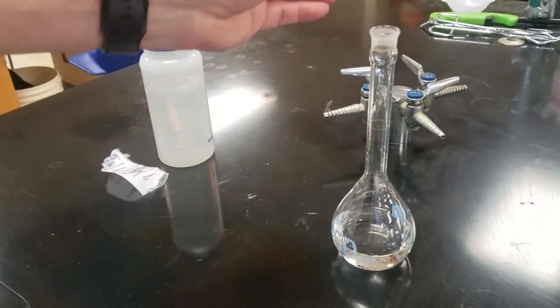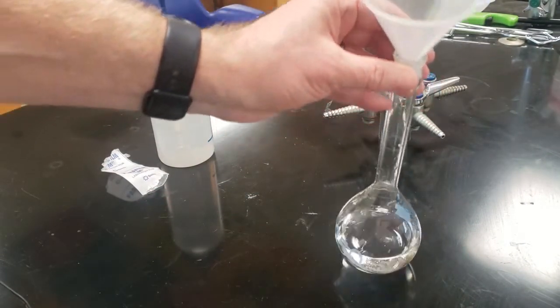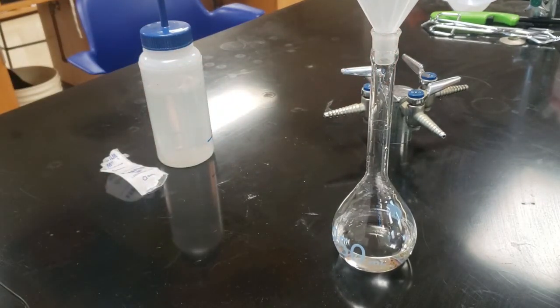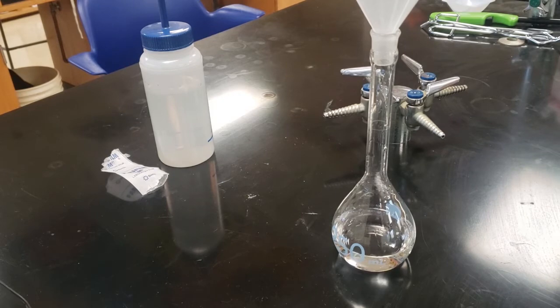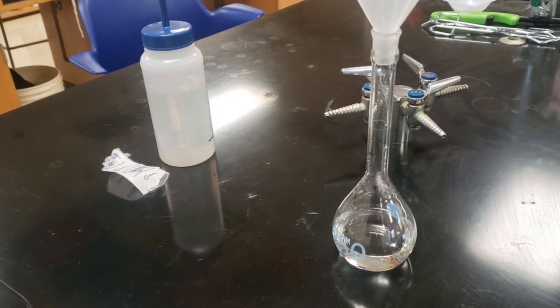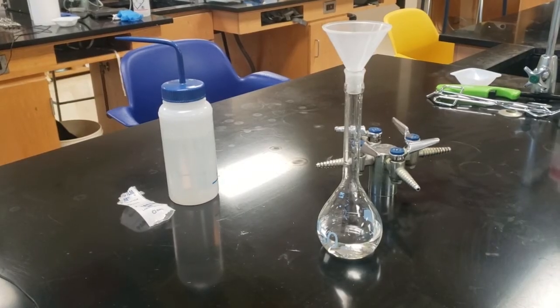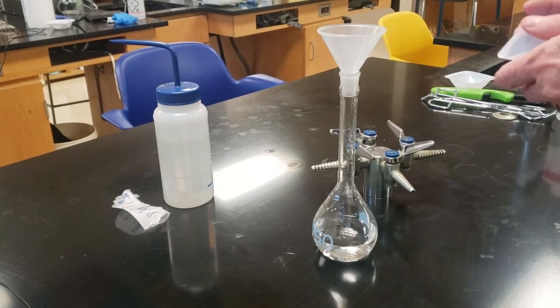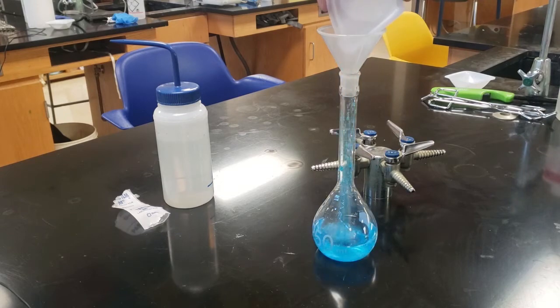So here's our powder funnel. It doesn't always fit in there. This one does. If you have a 100 milliliter, it'll just fit on top and you have to hold it flush. Now, I'm going to get my already massed out copper sulfate. I tend to call it taco-ing the shell. So you taco it from opposite corners and you can pour it in.